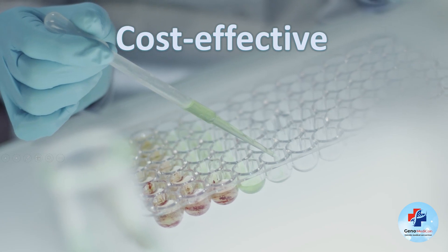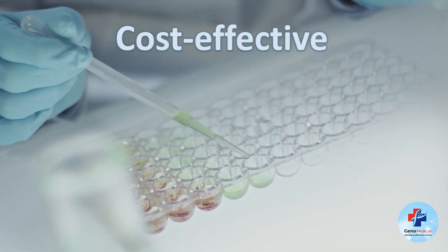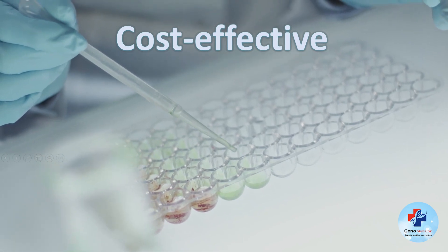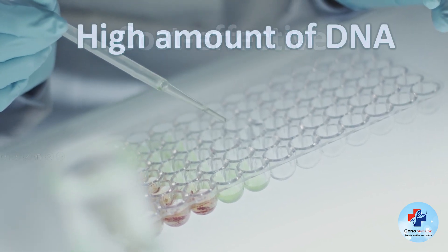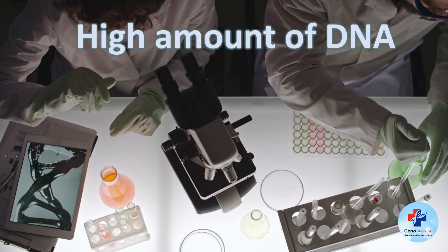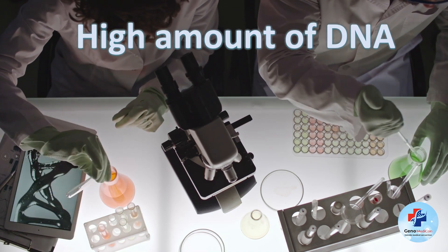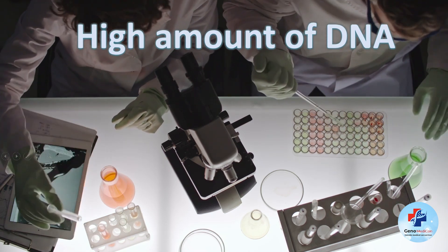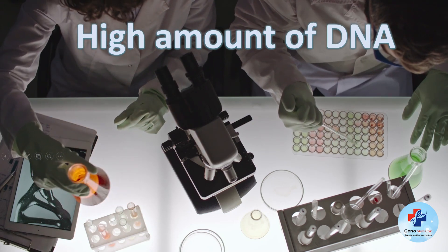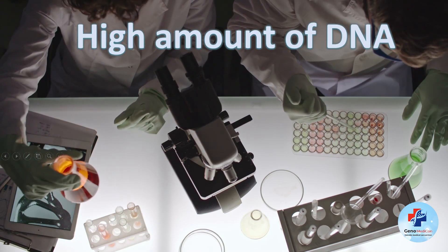In terms of cost effectiveness, it stands out compared to other techniques, as it doesn't involve expensive reagents or specialized kits. Importantly, the salt-out method typically yields a high amount of DNA, rendering it suitable for applications that demand a substantial quantity of genetic material, such as PCR or polymerase chain reaction, or DNA sequencing.